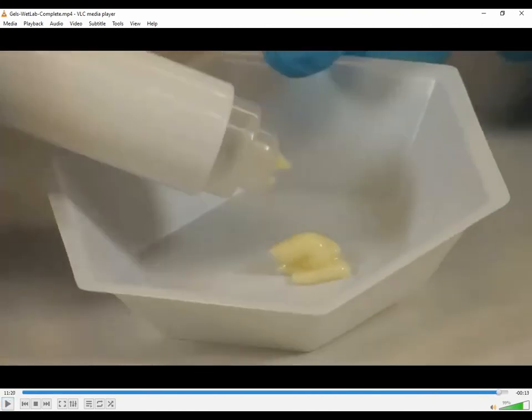So there you have it. You're going to unlock it. You're going to hold it straight up and down. It works a little better, and then squish with your thumb, and it's going to squirt out. The first couple of times there are going to be some air bubbles. They may not be consistent. So just squirt, squirt, squirt until you get nice consistent squirts to come out.